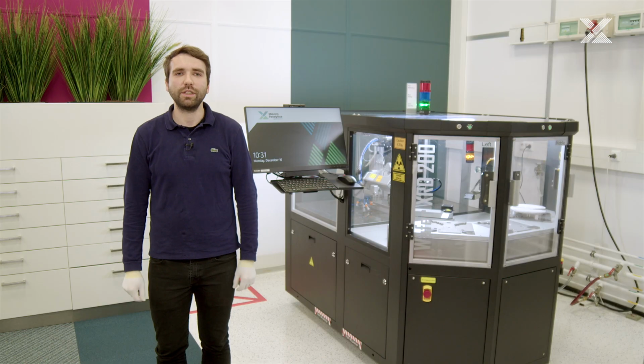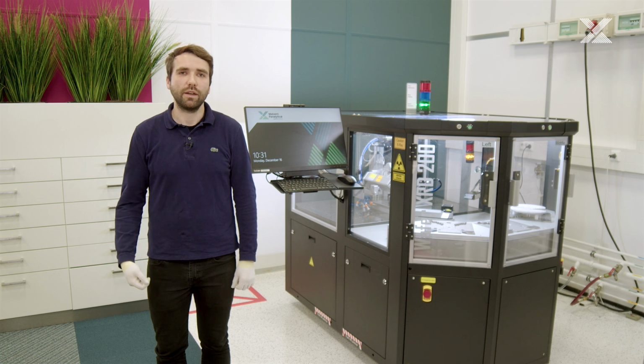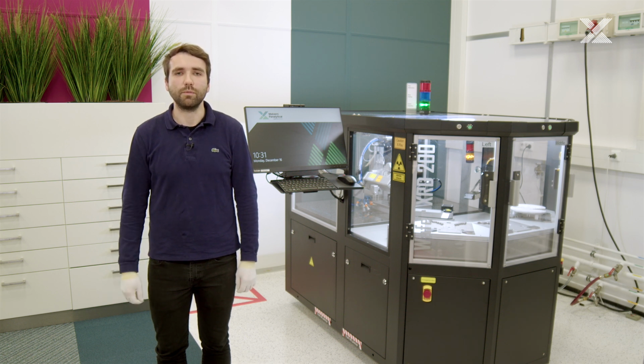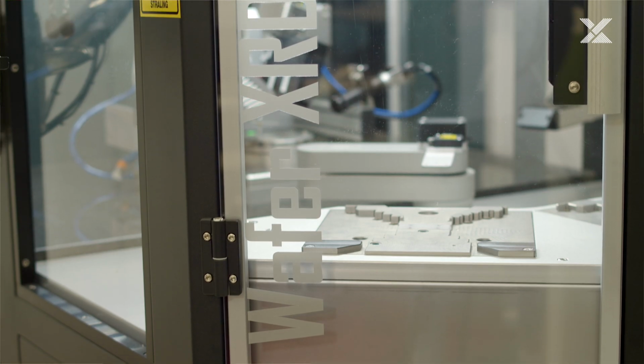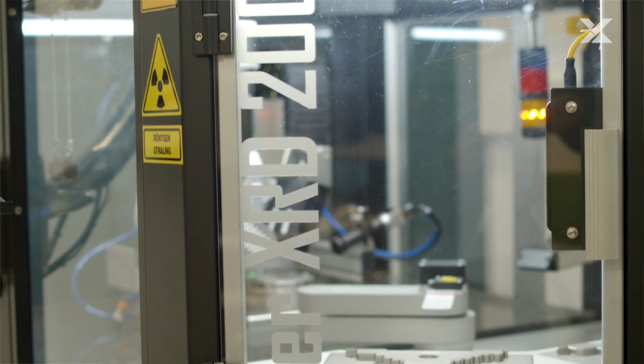more. The Wafer XRD 200 system can be used for a variety of materials, a variety of semiconductor substrates like gallium nitride, indium phosphide, silicon carbide, sapphire, and many more. This very system is set to silicon carbide, as silicon carbide is an extremely important material, interest in which is skyrocketing nowadays due to its applicability in high power applications.